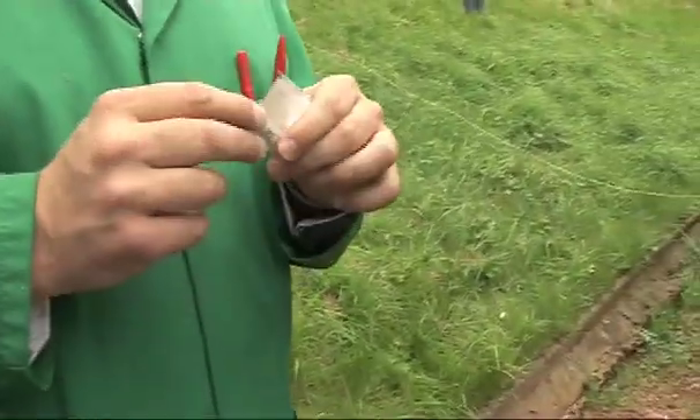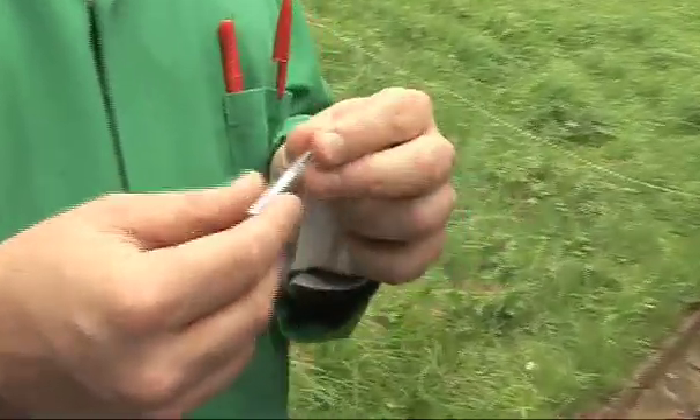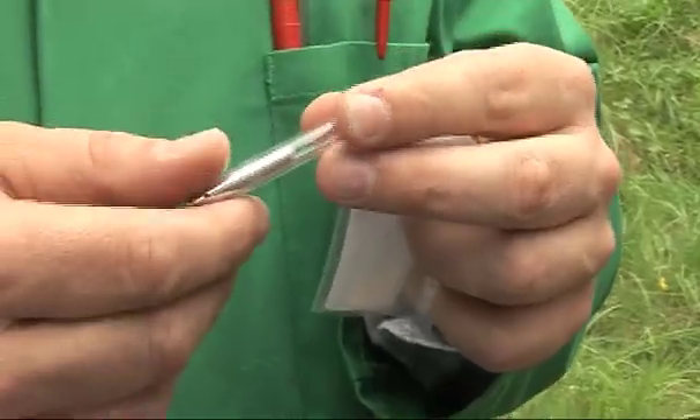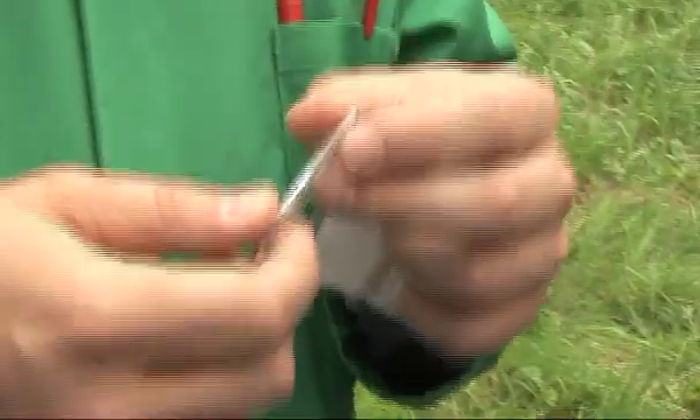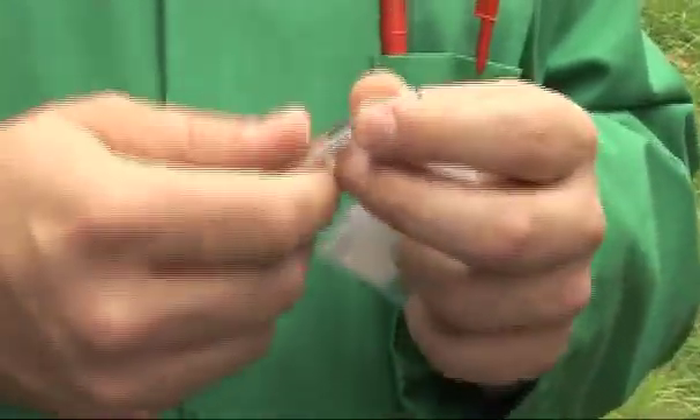It's one of the alkali metals so it's very, very reactive — a bit like sodium, but perhaps a little bit more. So the metal itself is quite low melting. It won't melt with my hand though, unfortunately, so I'm not going to show you it liquid now. But you can see there's one gram of the metal inside this glass ampule. It's very reactive and we're going to explore its chemistry now by putting this into some water.